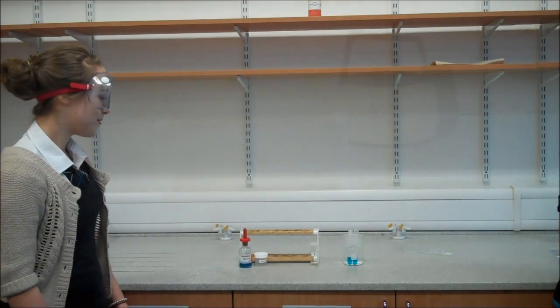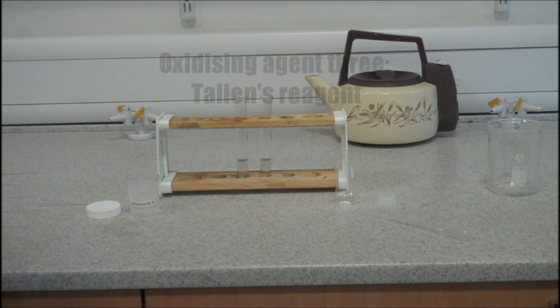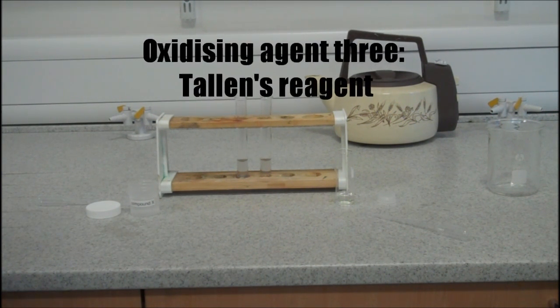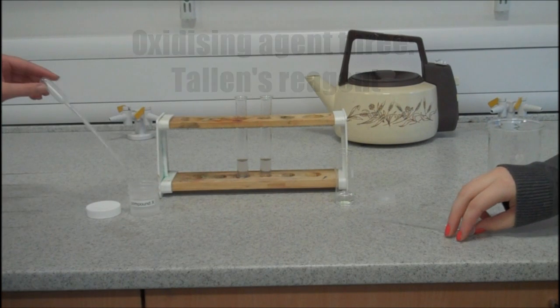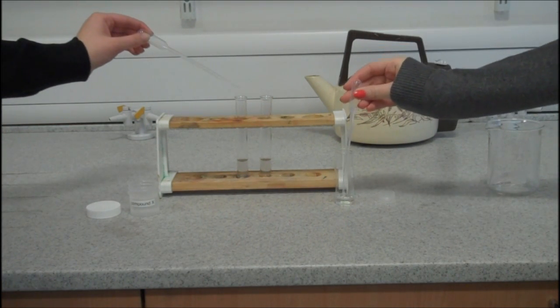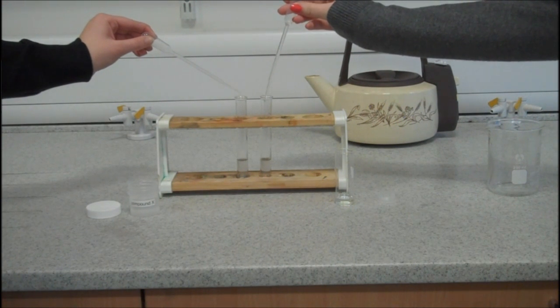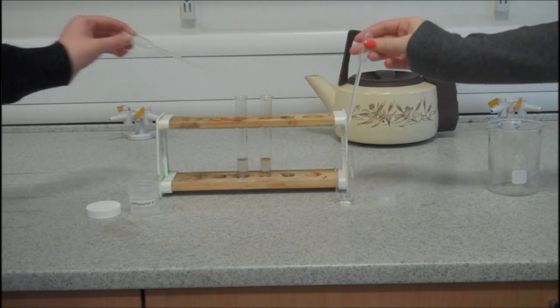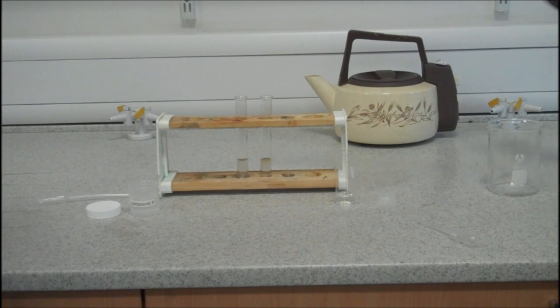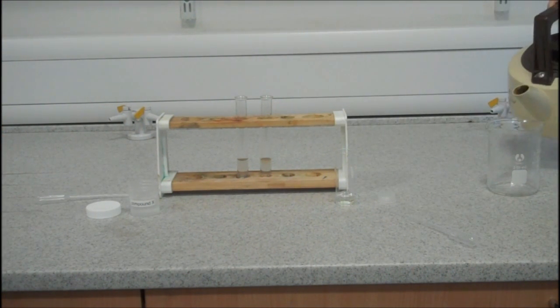We then wait and watch for any changes. Add 3cm depth of Tollens' reagent to two very clean test tubes. Add 5 drops of compound X to one and 5 drops of compound Y to the other. Place both test tubes in a water bath and observe any changes.